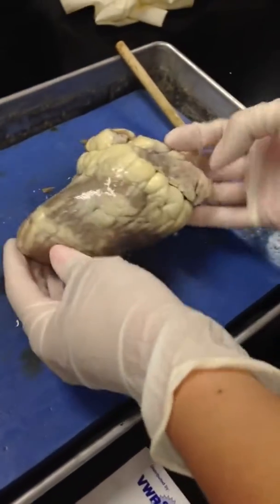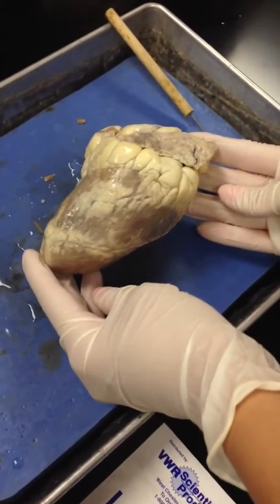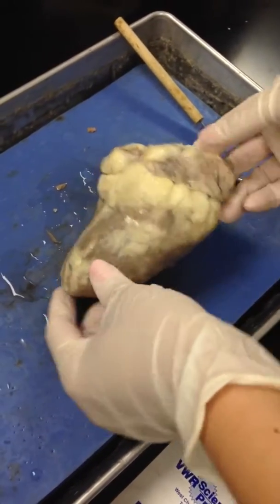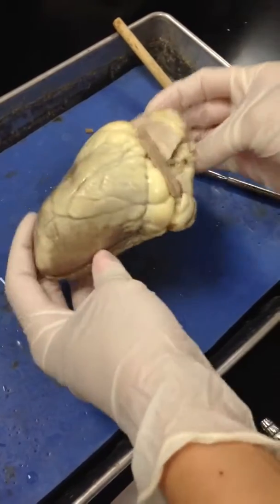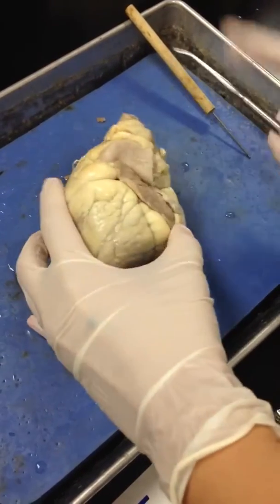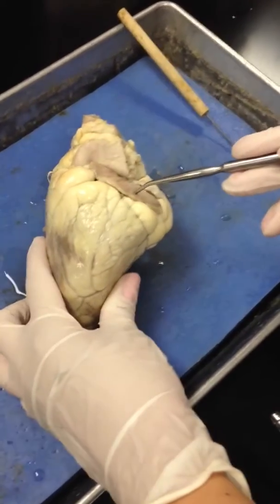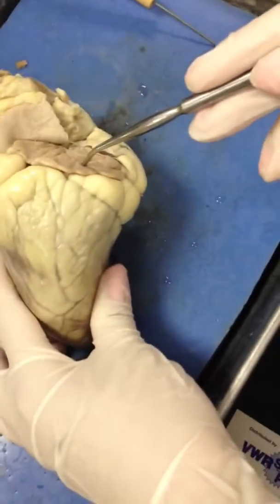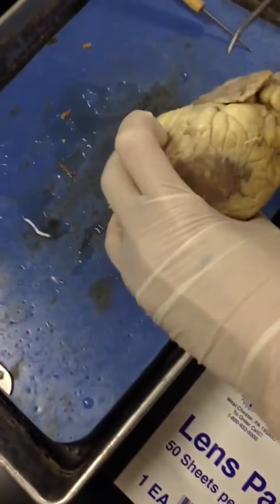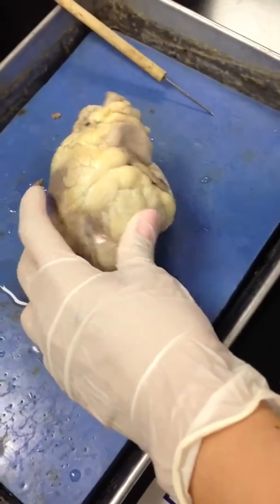And so then on this side of the heart we don't see the pulmonary trunk. What side is it? Posterior. Posterior side of the heart. Good. Okay, let's identify a few structures. What is this? It's the left auricle. Left auricle. Good. That means that this is the right auricle. Right auricle. Good.